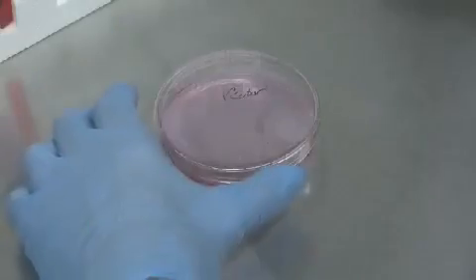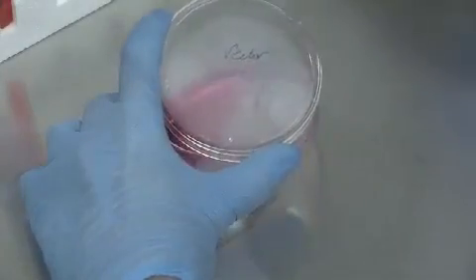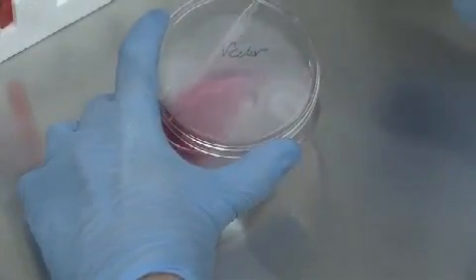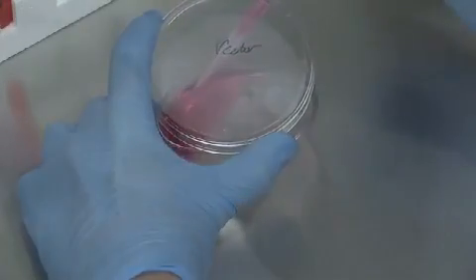Let us now begin the Cell Cultured Wound Closure Assay. The cells used in this assay may be grown in tissue culture plates using conventional cell culture techniques. To begin, aspirate the growth medium.